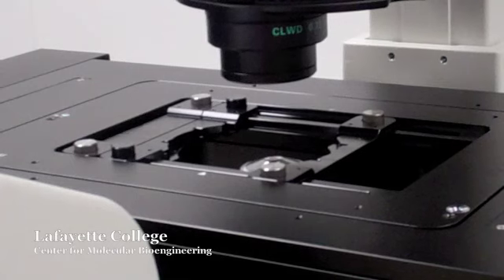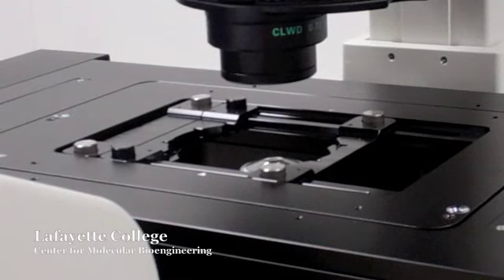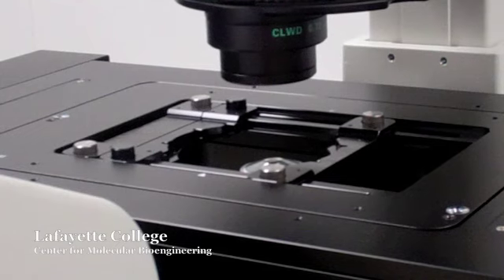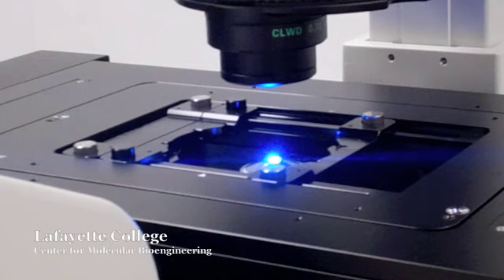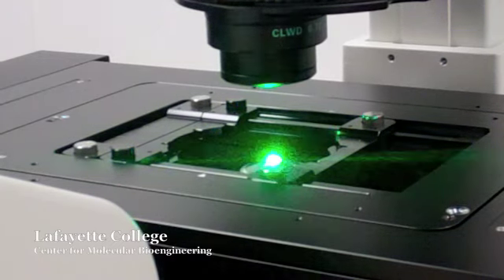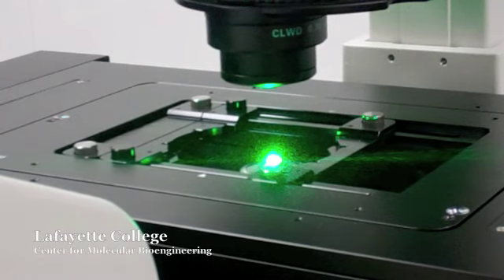Next you will need to decide which wavelength of light to use. There are three available filter cubes to choose from: UV, blue, and green. DAPI fluorescence will absorb the UV light and emit blue light through the eyepiece. FITC, or fluorescein, will absorb blue light and emit green. TRITC, or rhodamine, will absorb green light and emit red.